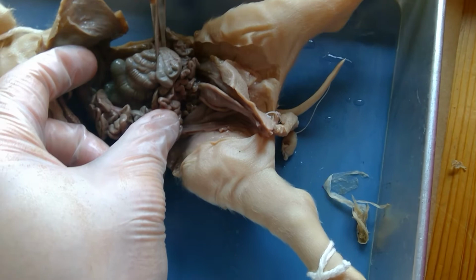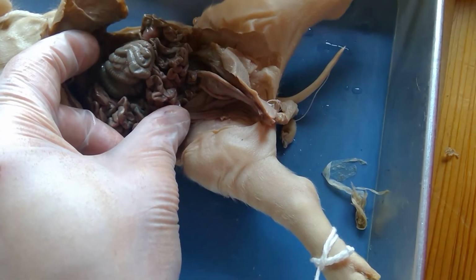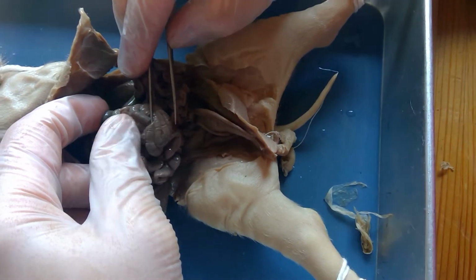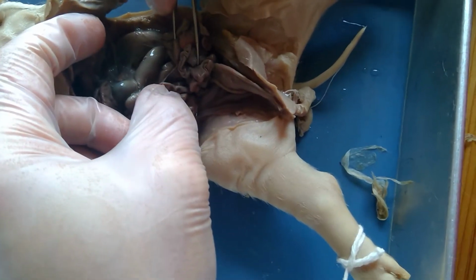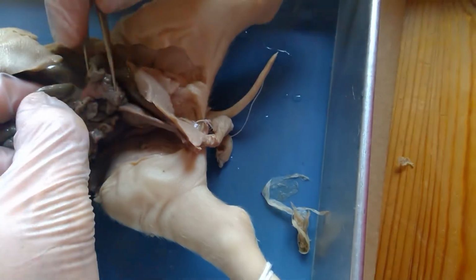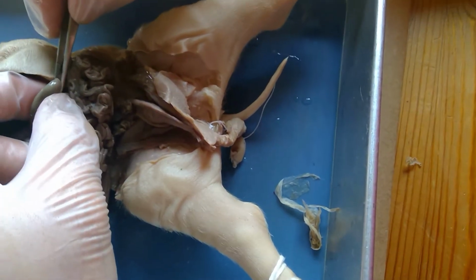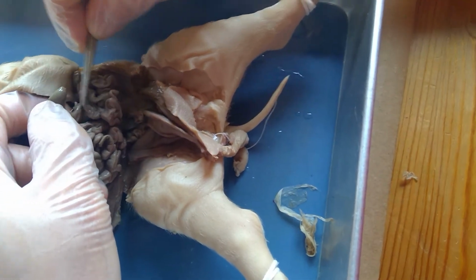So this is where all the digested food goes. It's all been broken down into stuff that the pig can't digest anymore. And basically at that point, it'll get some nutrients or vitamins absorbed through bacteria, and then feces will form. So there is, just like in a baby, feces inside this, but the feces that's formed is called meconium. And the meconium is basically a greenish type.